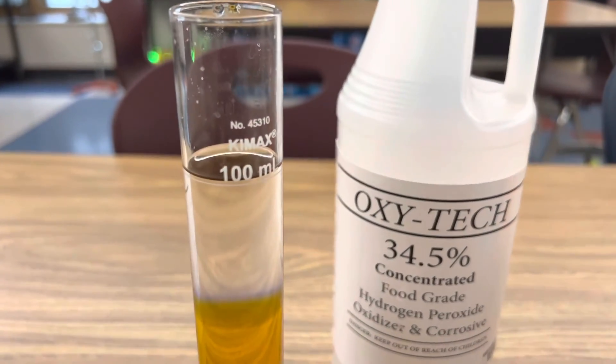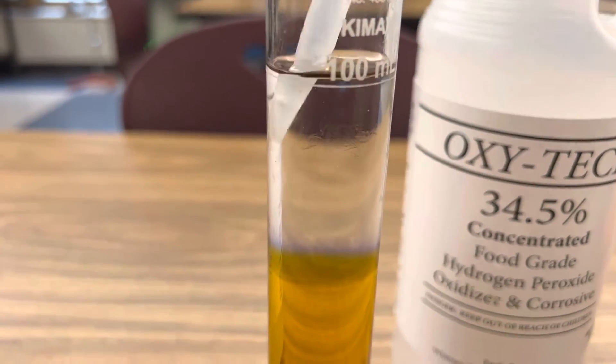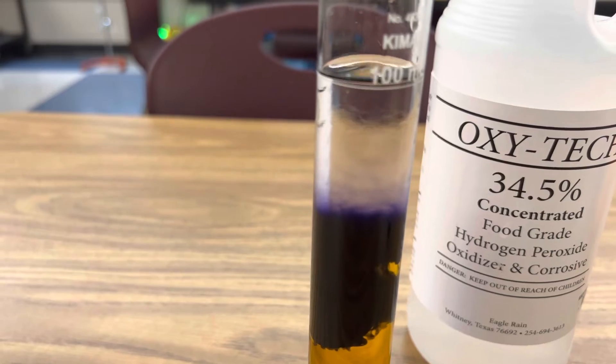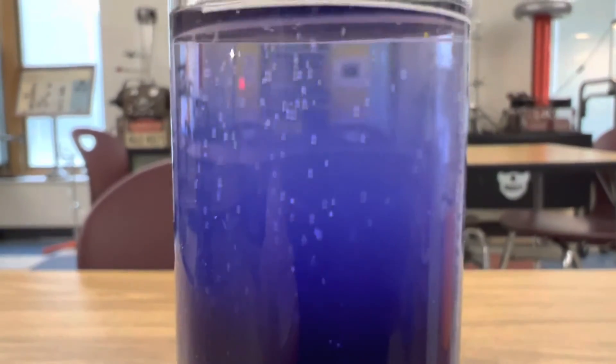Now we're ready to add our drops of hydrogen peroxide — you can see it's clear. Watch what happens to our solution. There's that blue layer. Let's see if that rises in our solution of ethanol and stays stable. Here you can see just a beautiful suspension: down below you have your potassium dichromate, and up above you have your chromium peroxide that's stable in the ethanol. Just look at that — it's amazing.